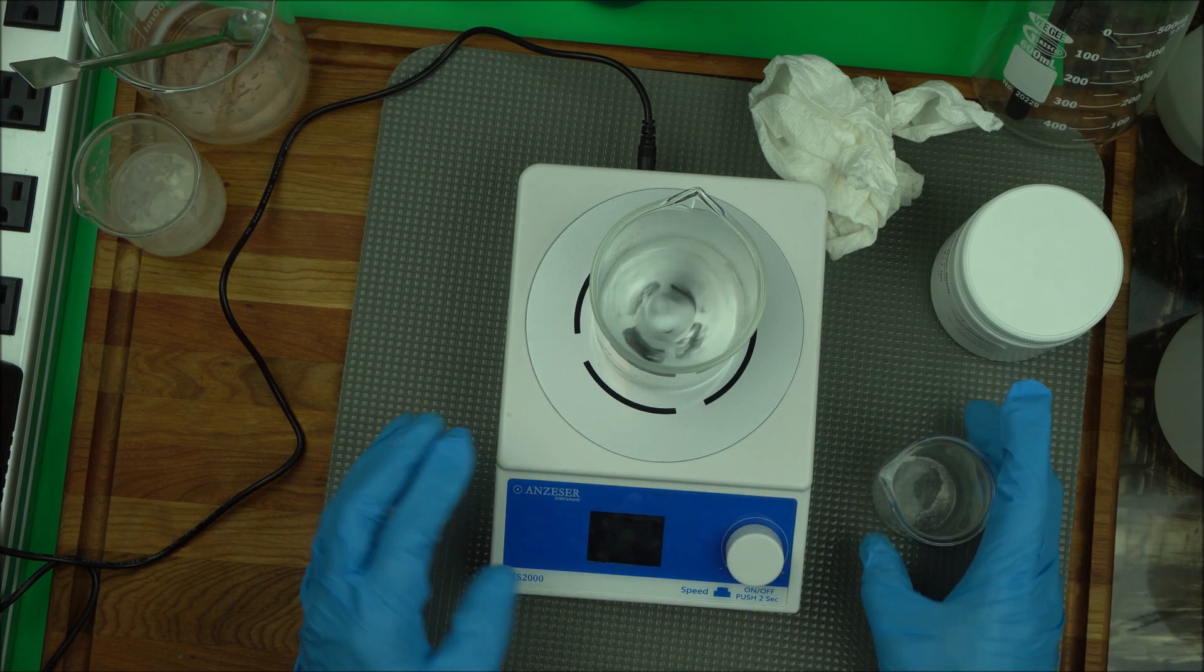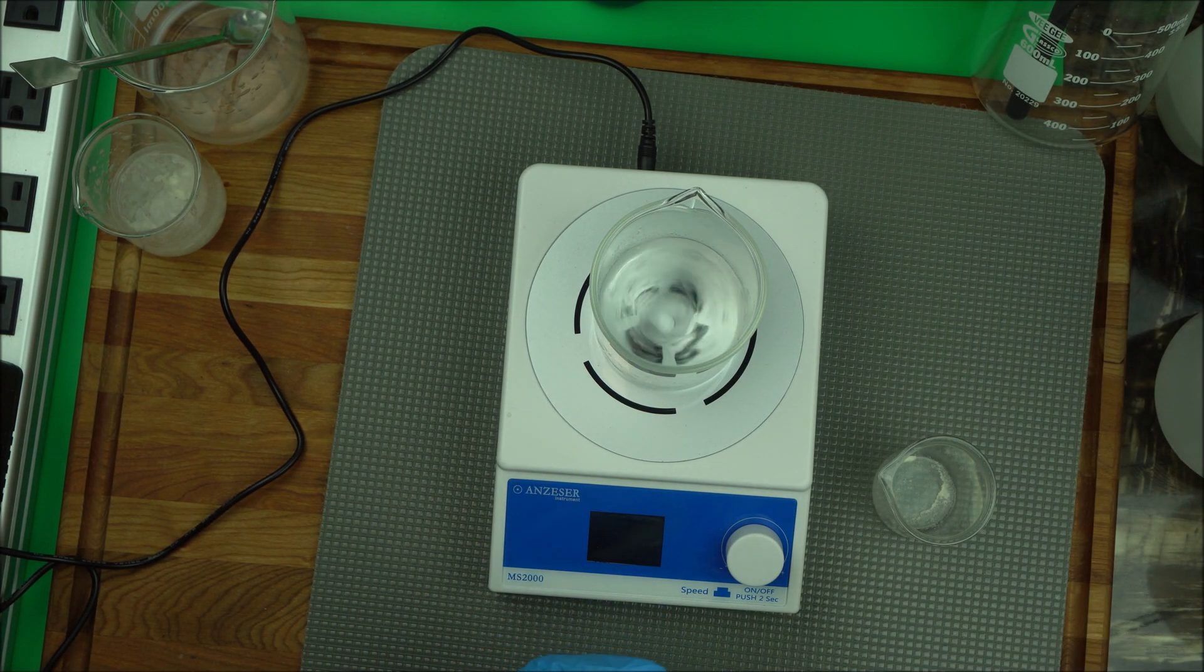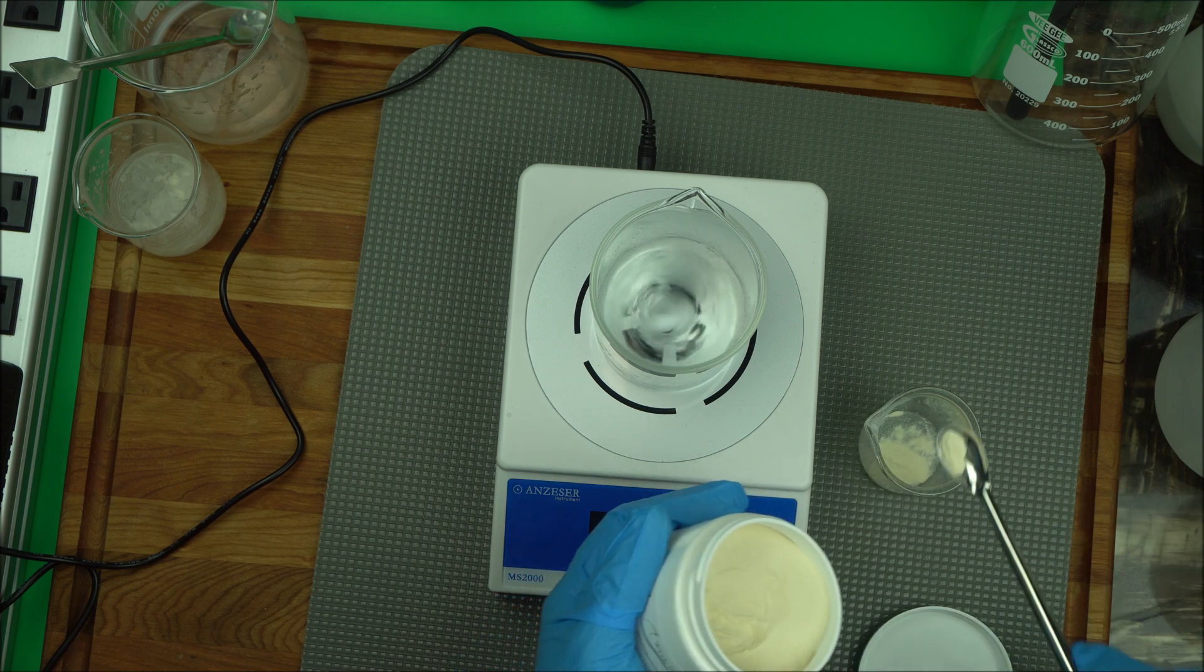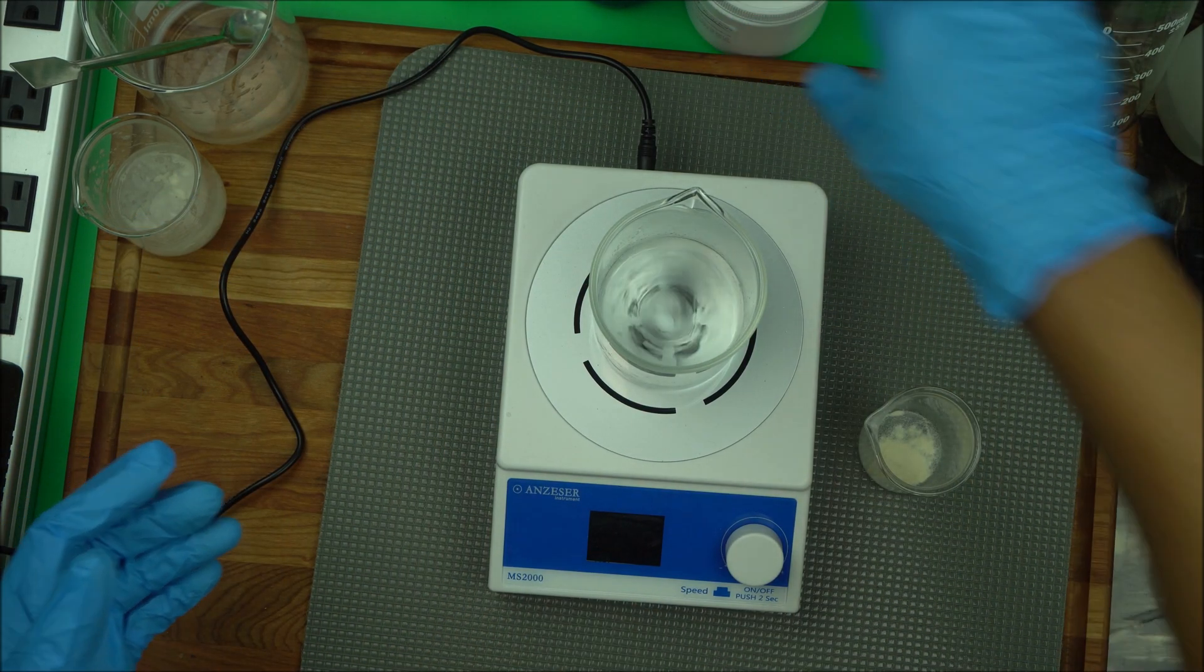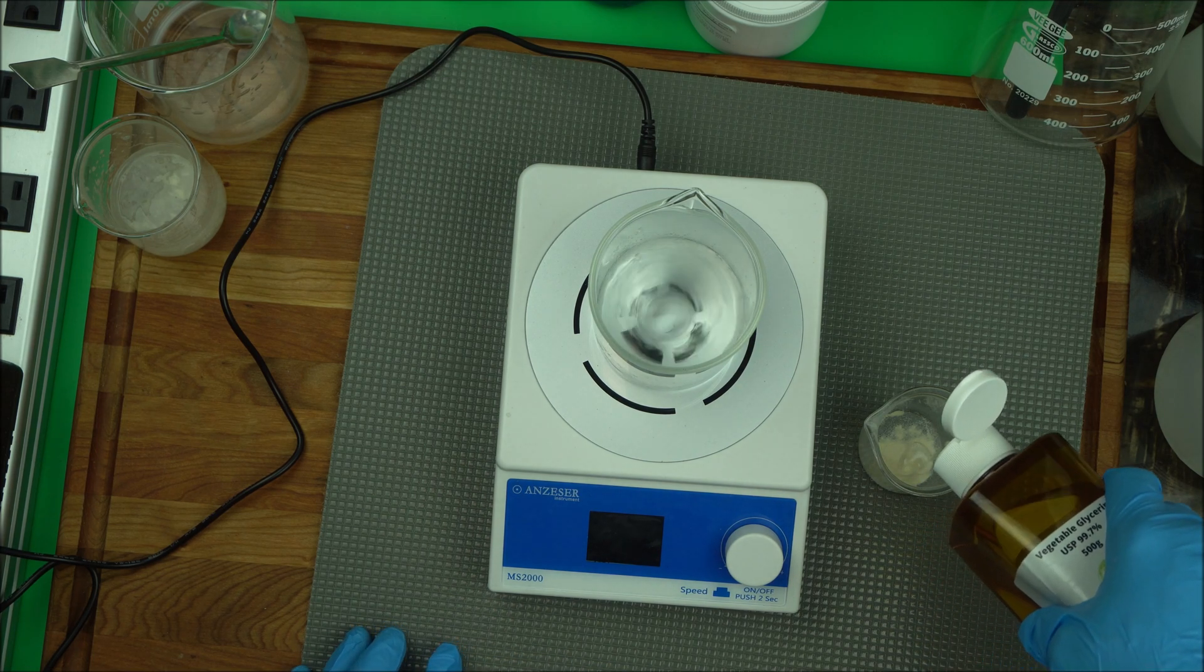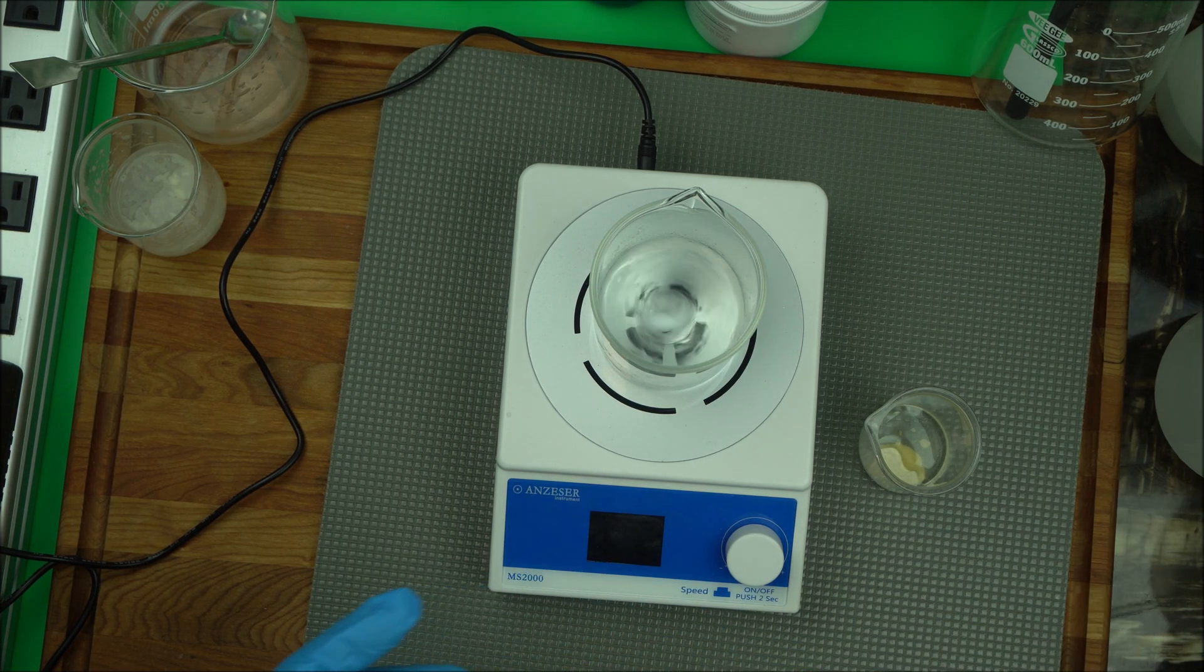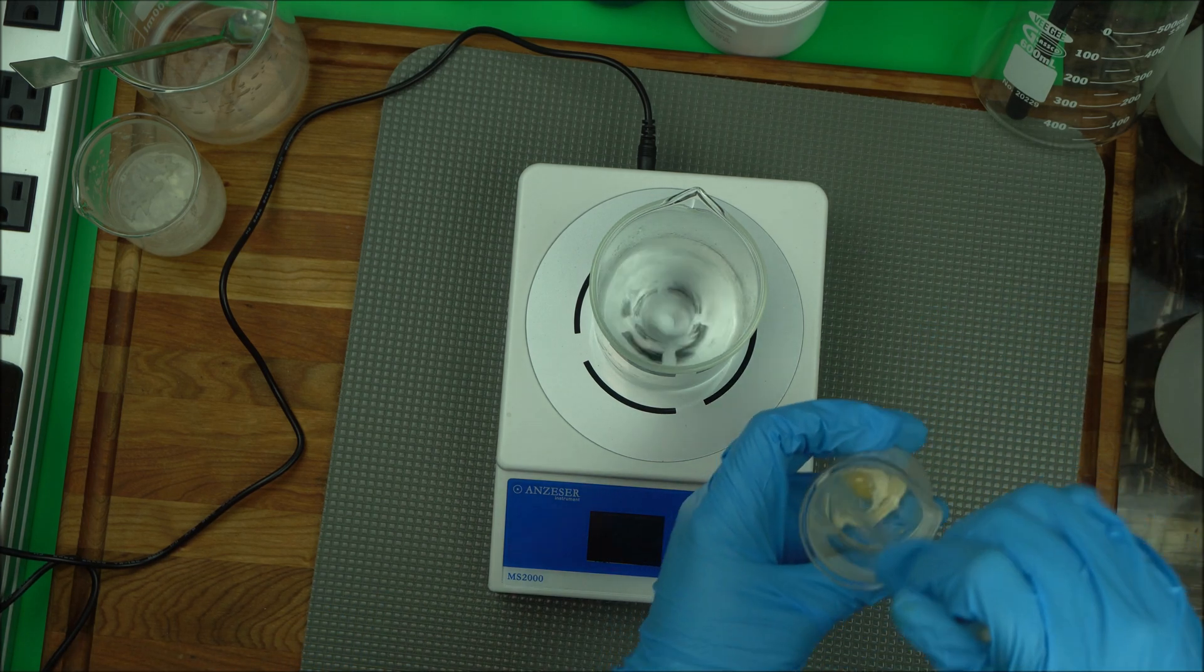We're going to let that start. So while that is running, we're going to add glycerin to our gum. Measure your gum and add glycerin to it. You ask me why do I still have to add glycerin when I have a magnetic stirrer? Add glycerin to gum. Sometimes if your gum is 0.2%, add that glycerin depending on what you're making. You can add glycerin at 5% or even less. Mix it well.